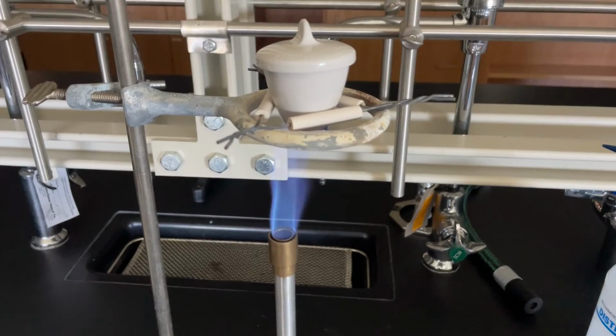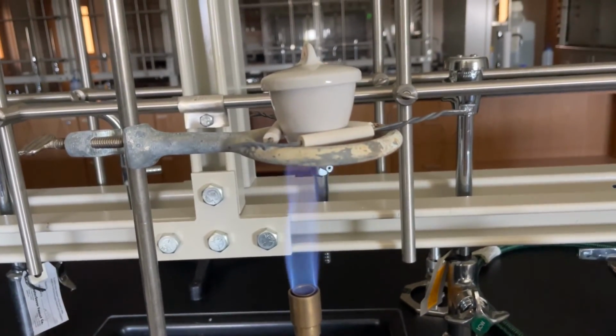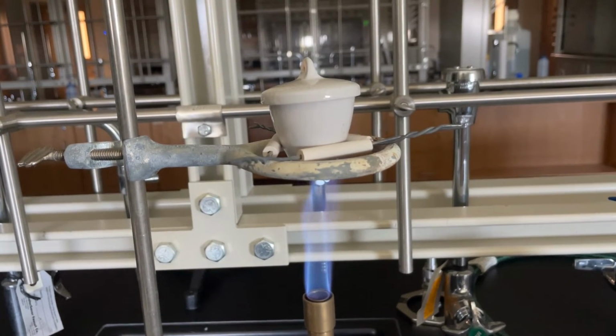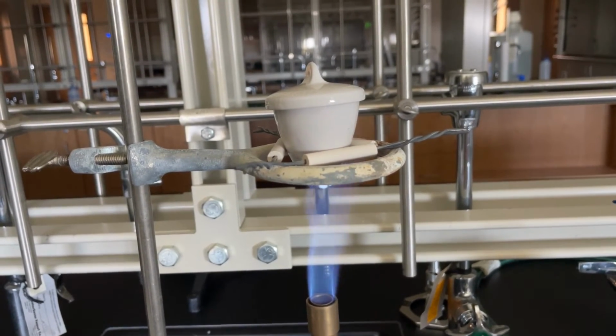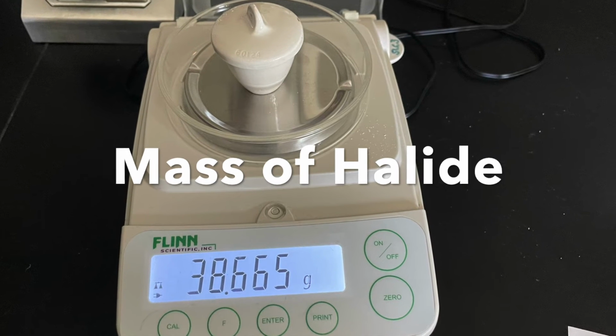And so again, this heating process takes several minutes. We're going to heat it very vigorously here towards the end, just to really get any of the additional water out. And then we will let it cool. It does take about 10 minutes to cool this crucible to room temperature. And then we'll record the mass of the halide and the crucible, so make sure to record that as well.